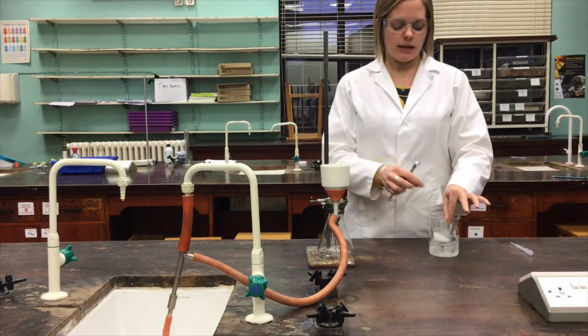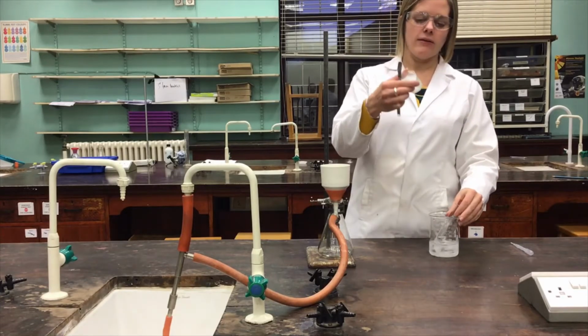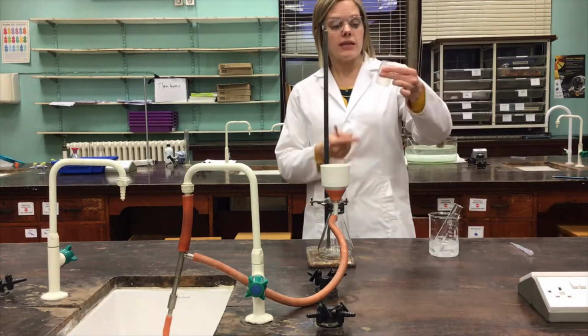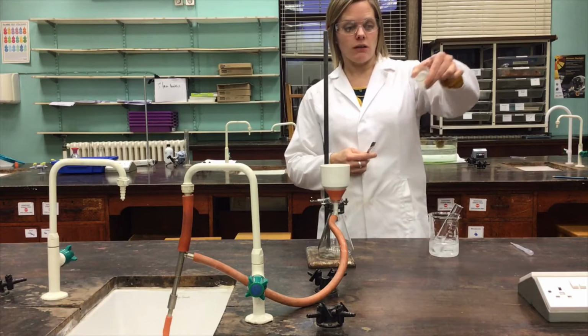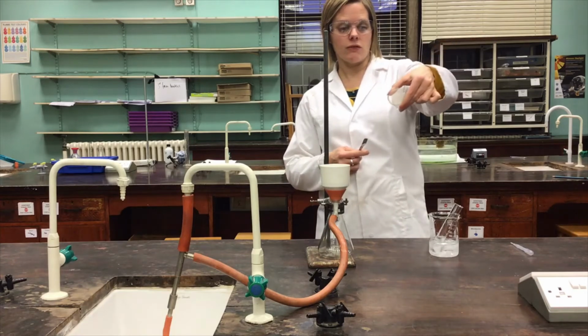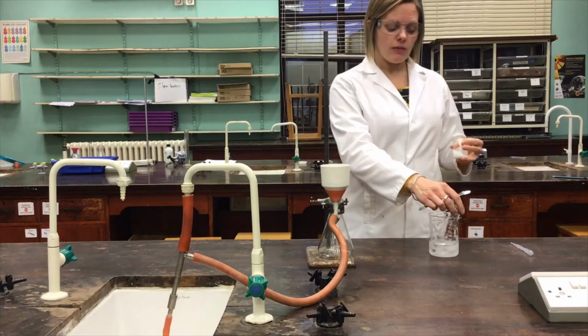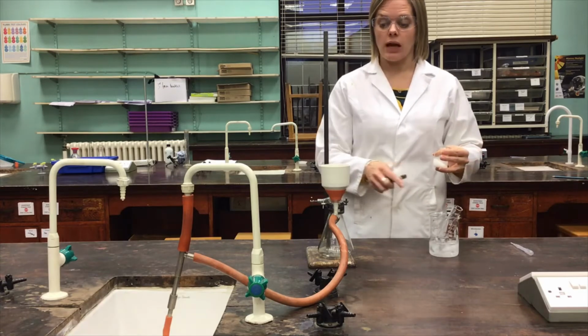The little beaker has now been sitting in ice for a period of time, and I took a glass rod and scratched the surface of the beaker to help with the crystallization, and hopefully you can see that there are some nice crystals formed in the bottom of this beaker now. I've also moved the rest of the ethanol onto ice to get some ice cold ethanol for the next stage.